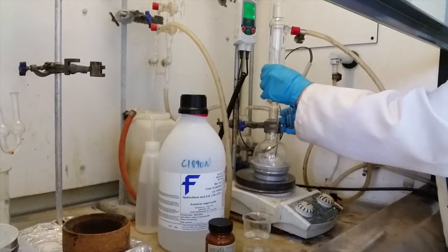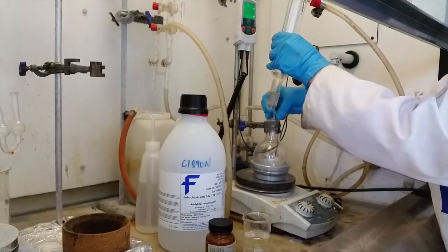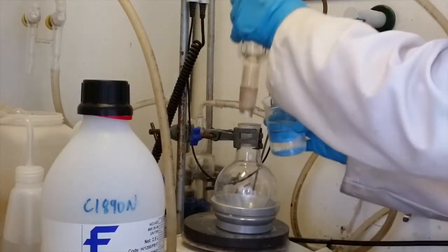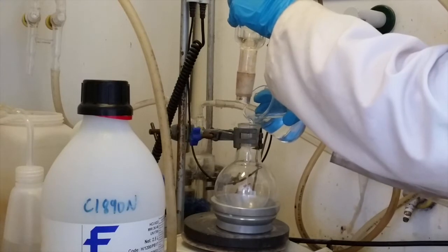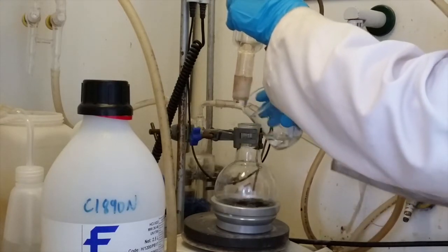Add your nitrated porphyrin to your round-bottom flask ensuring that you have also added a stirrer bar. Next add the 6-molar HCl to the porphyrin making sure that the porphyrin is fully dissolved. Careful not to spill this acid on the aluminium heating block.